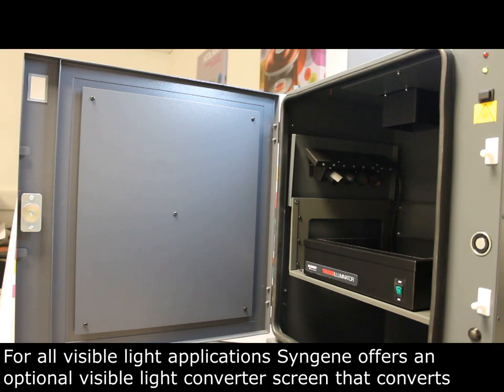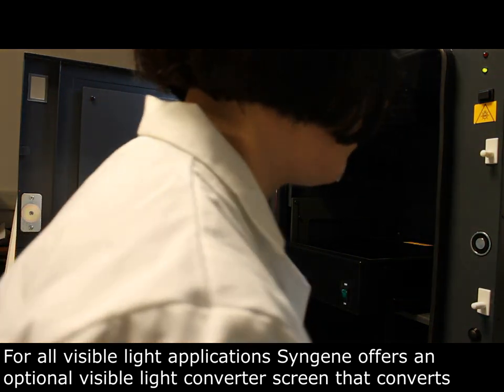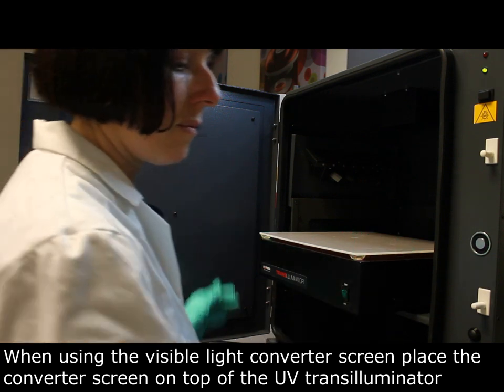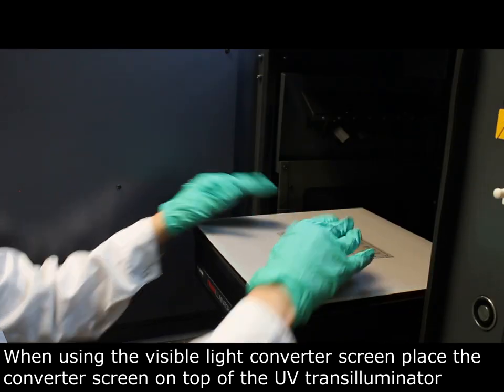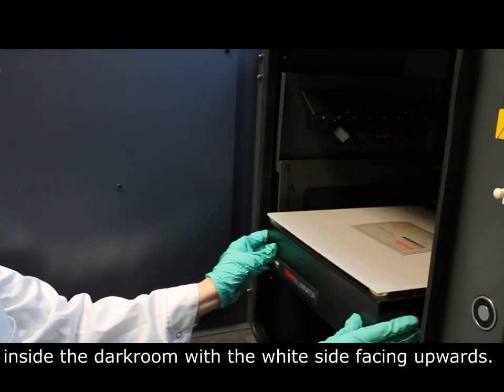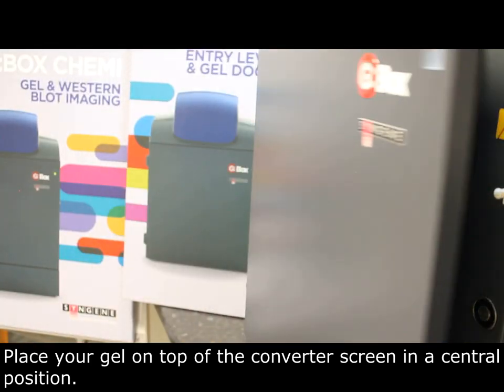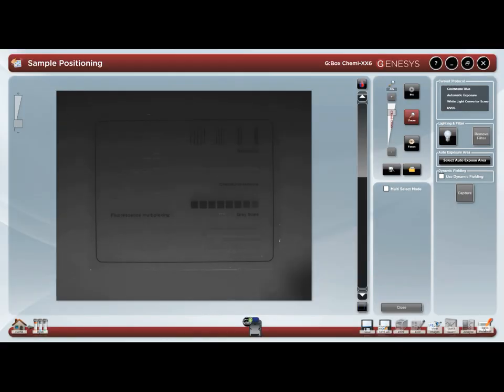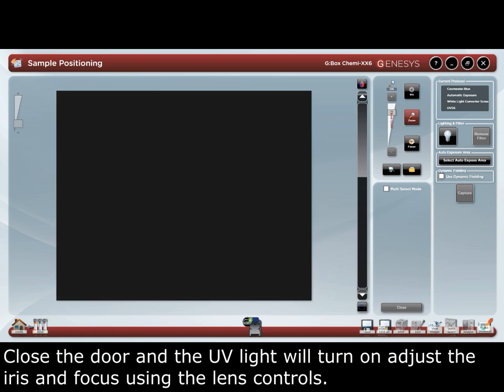For all visible light applications, Syngene offers an optional visible light converter screen that converts UV light to visible light. When using the visible light converter screen, place the converter screen on top of the UV transilluminator, inside the darkroom, with the white side facing upwards. Place your gel on top of the converter screen in a central position. Close the door and the UV light will turn on.